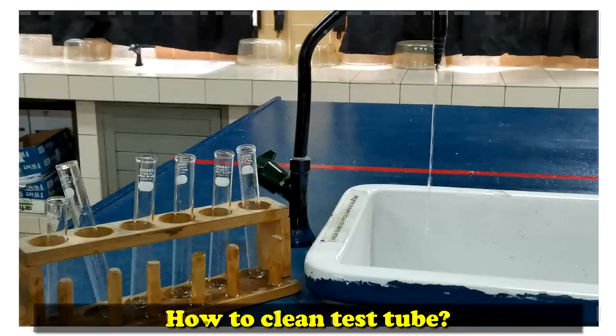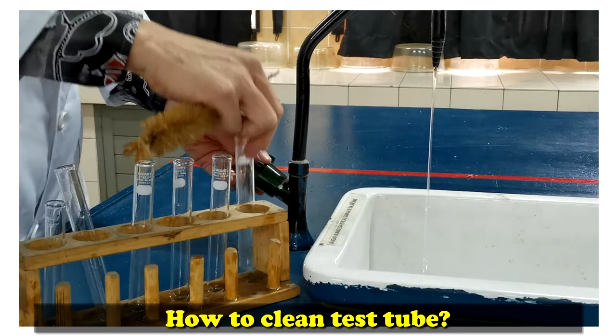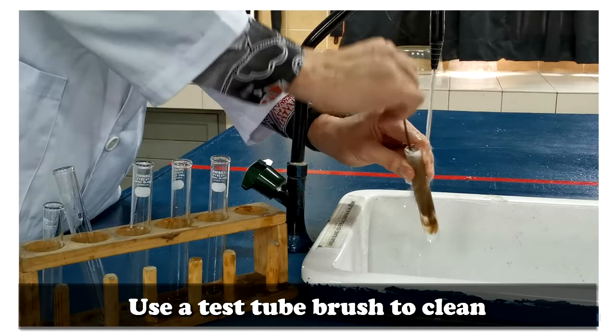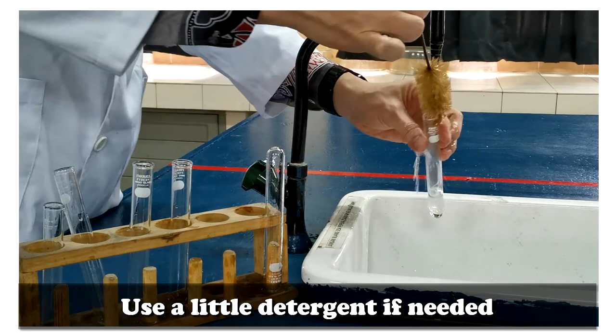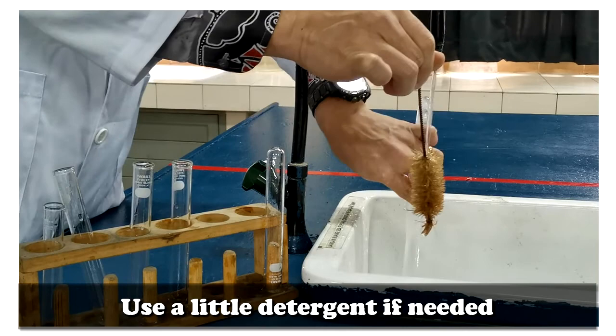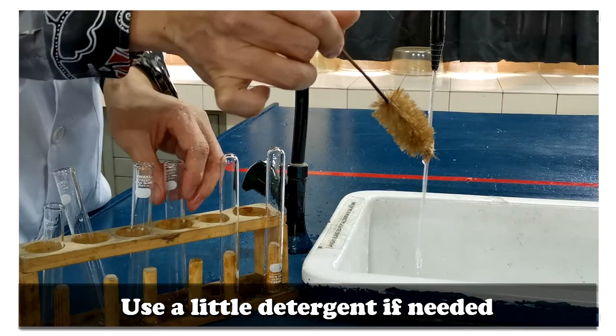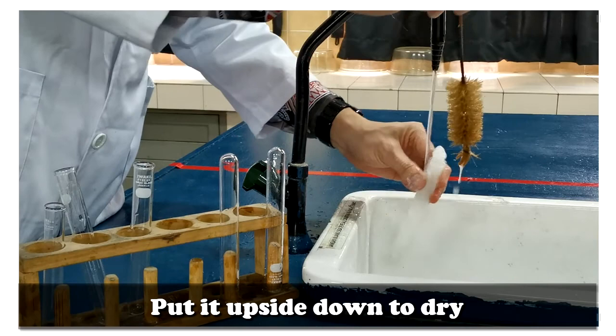How to clean test tubes? Use a test tube brush to clean it. You can use a little detergent if needed. Put it upside down to dry.